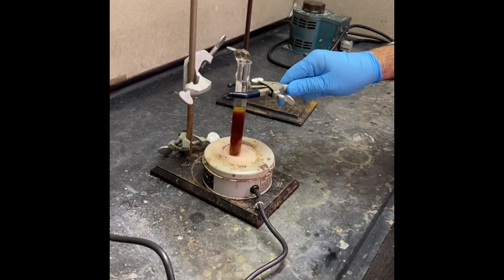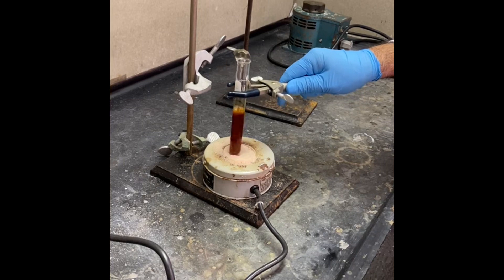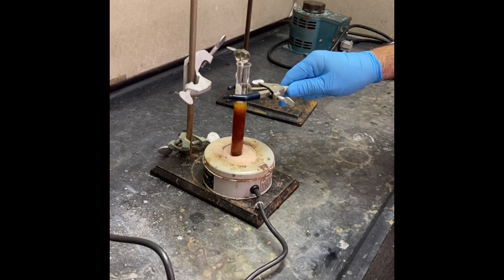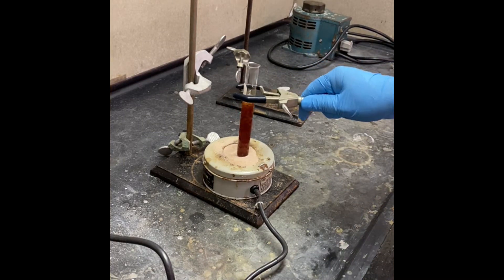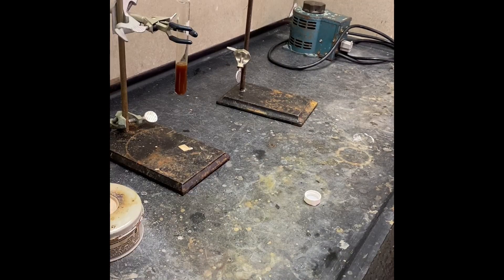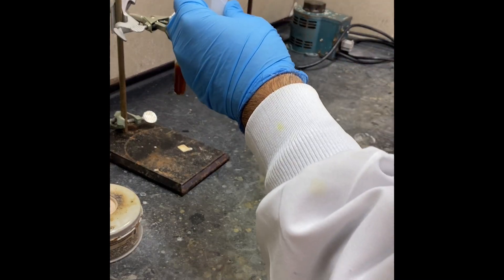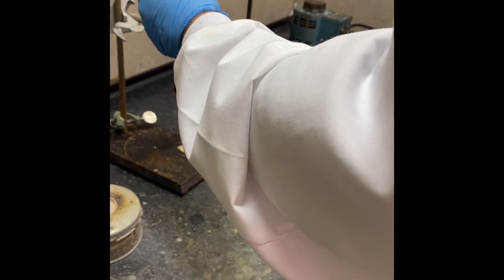We're going to add 2 mL of acetic acid. The reaction time is up, so now I'm going to add 2 mL of acetic acid.